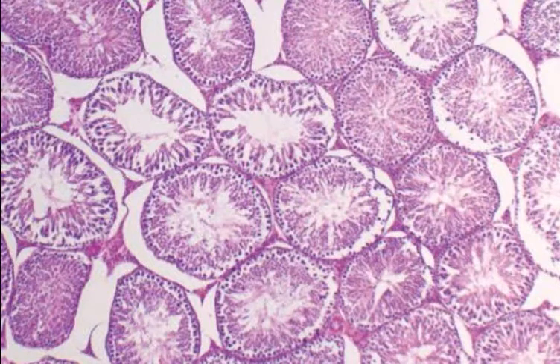TS of testis of a mammal. Internally, each testis is divided into several lobules. Each lobule of the testis contains a number of seminiferous tubules with spermatogonia and cells of Sertoli. In between the seminiferous tubules, masses of cells called Leydig cells are present.